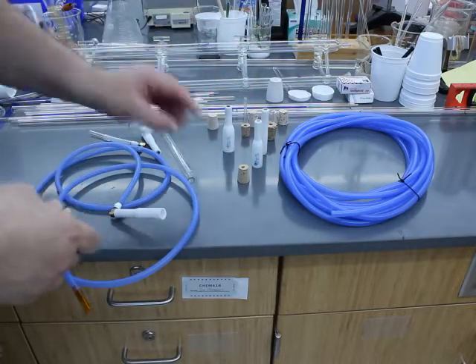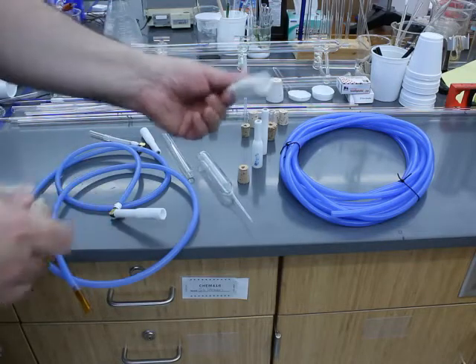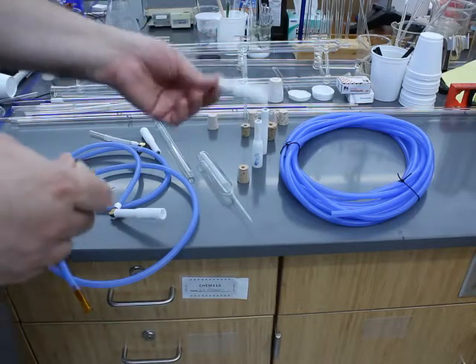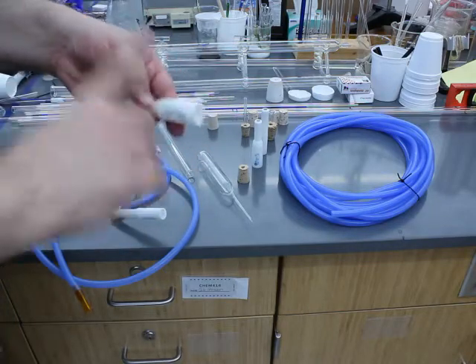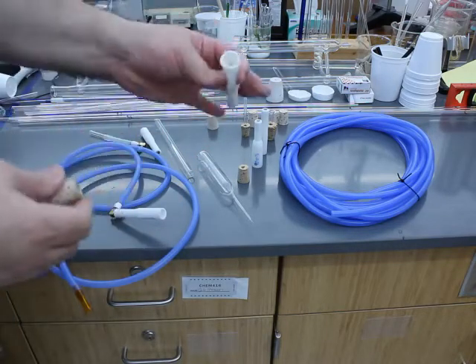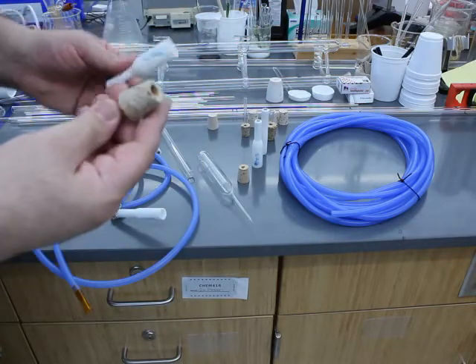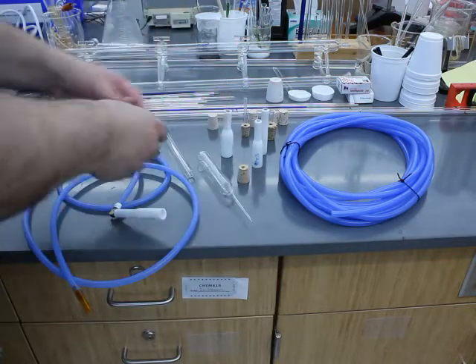These silicone adapters are very, very nice. You can't always use them if you have a size that is too big or way too small for this. But I've pretty much adopted these for almost everything that I do with the blow hose.